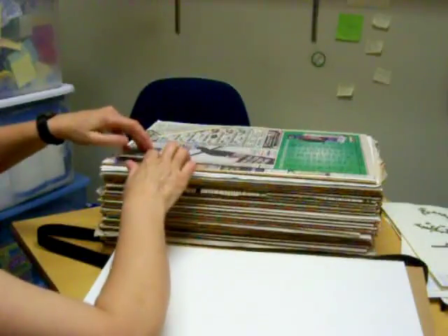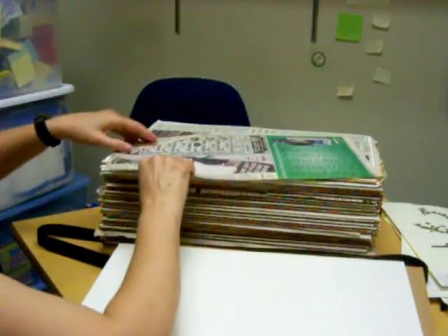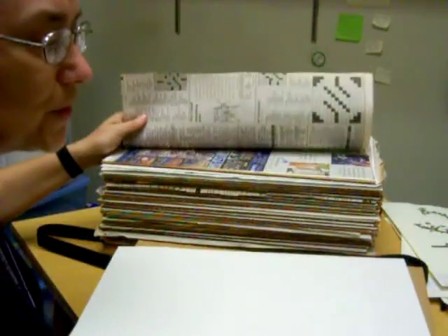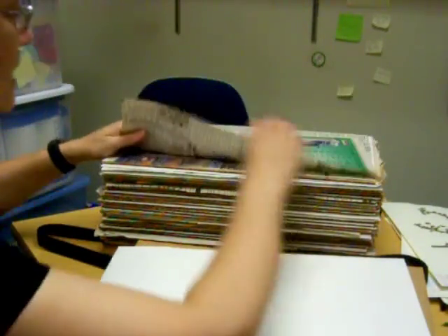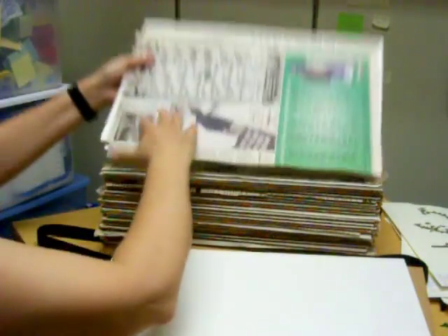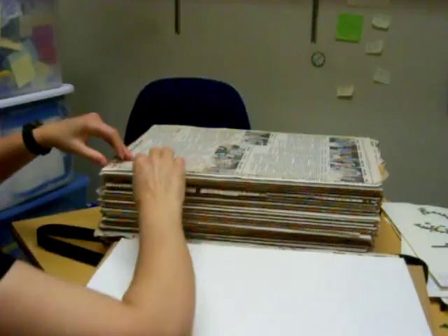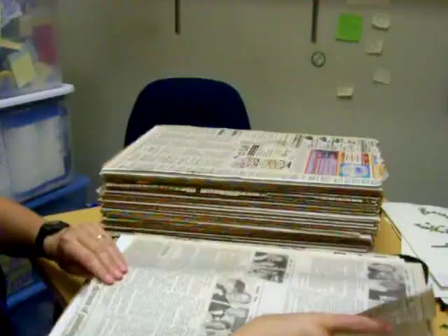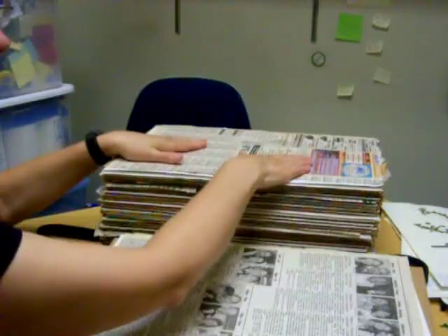And then there are a couple sheets of newspaper. Your plant goes between the newspaper sheets. I'll go down to the second layer because I'm going to do two plants, so you want to go down as far as you need to and then build on top.